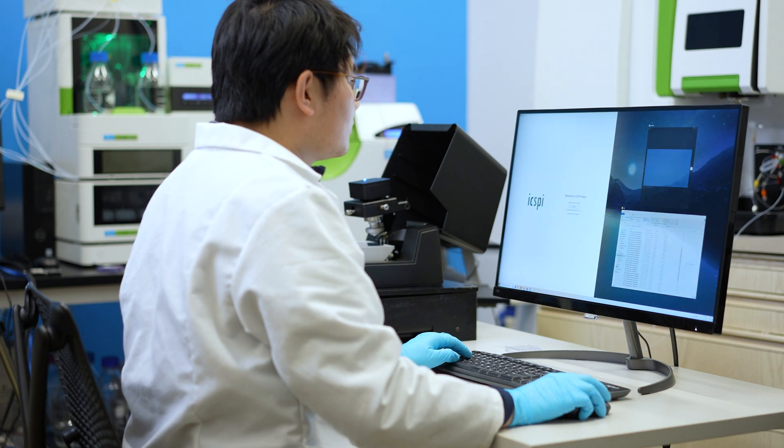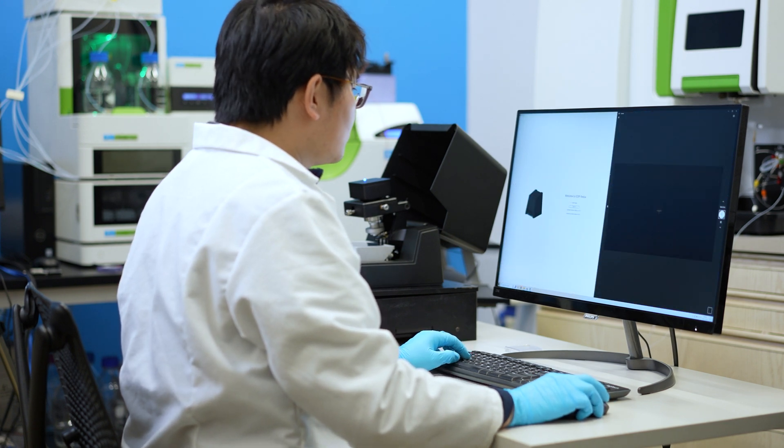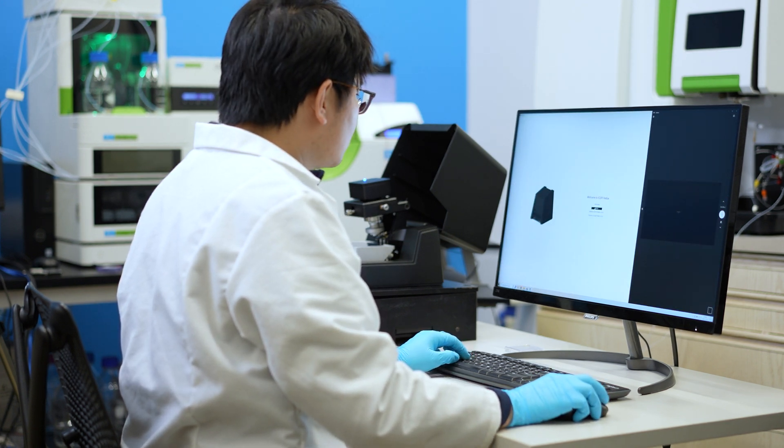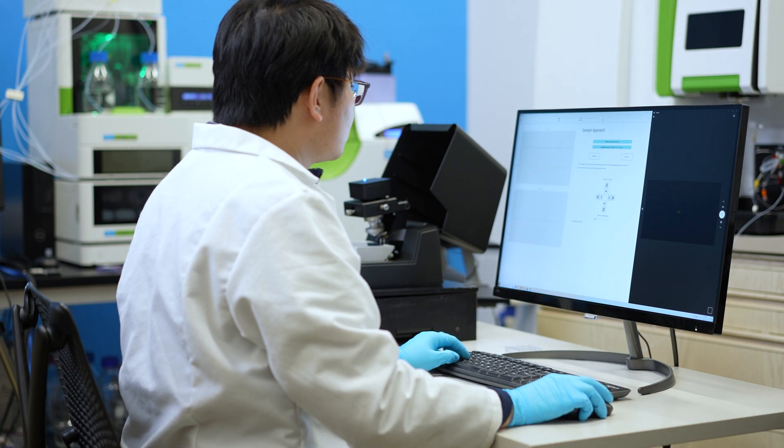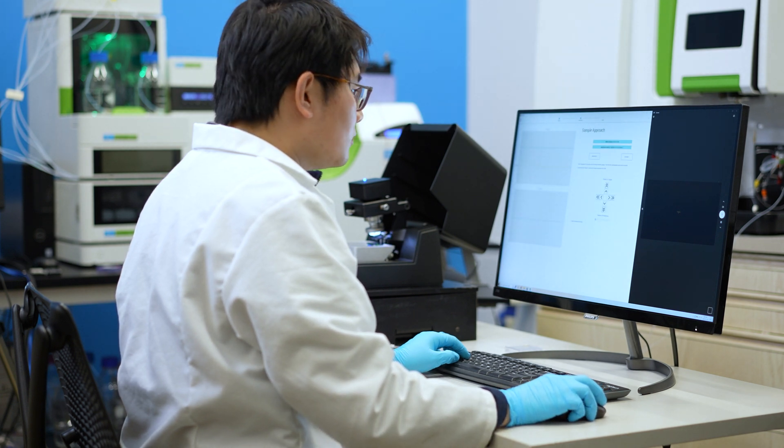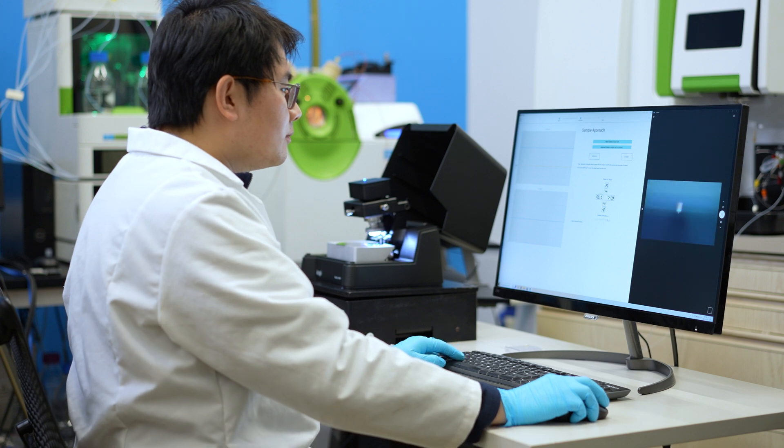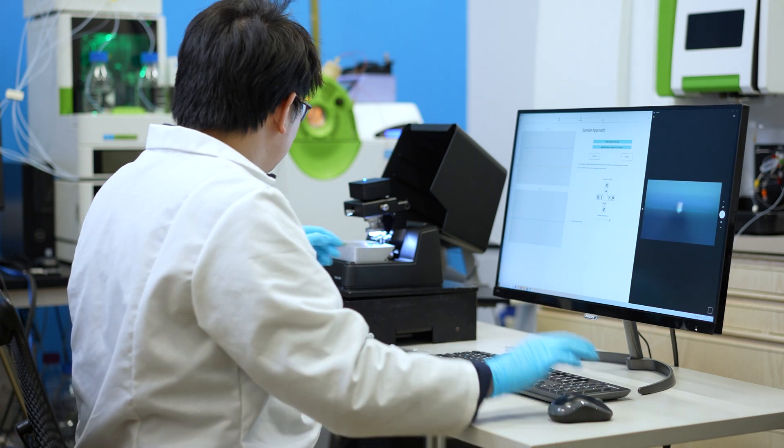Next, start up the software. Turn on the optical microscope illumination and adjust the optical microscope if needed.